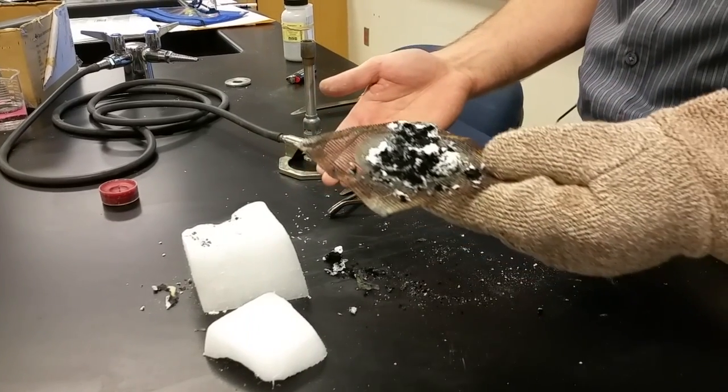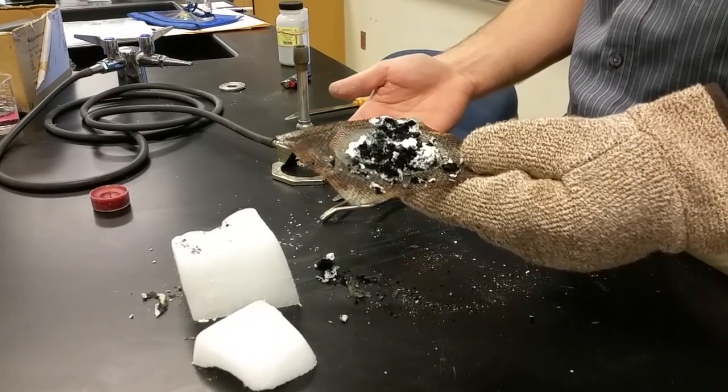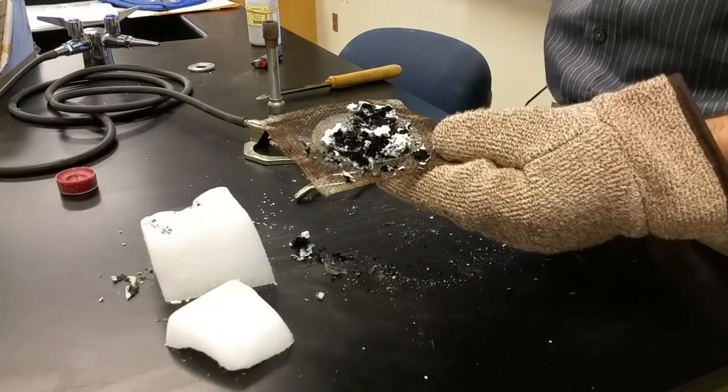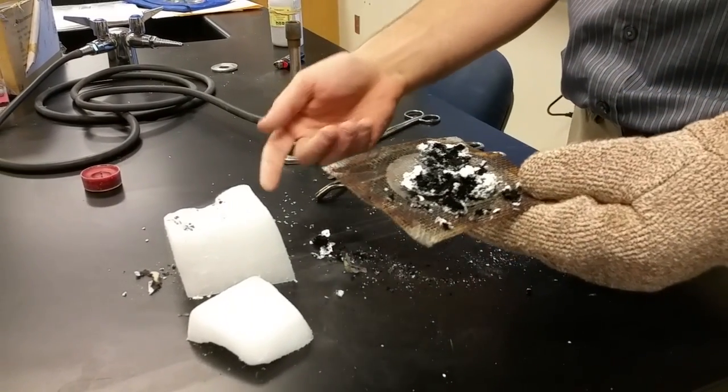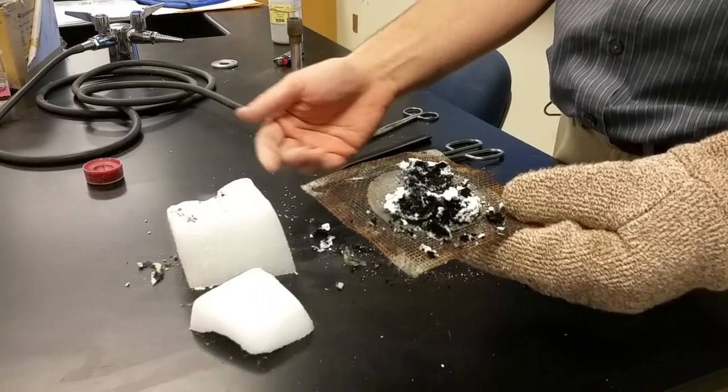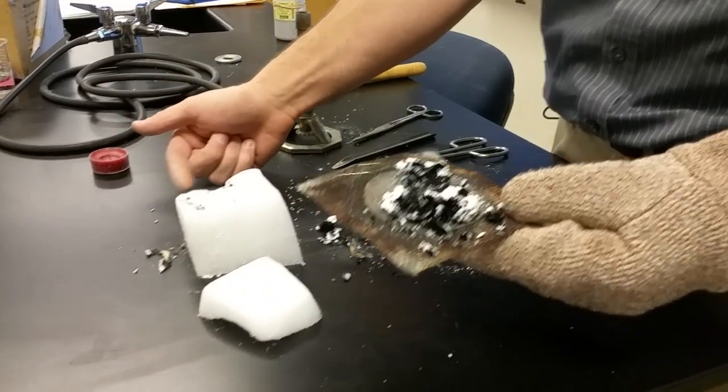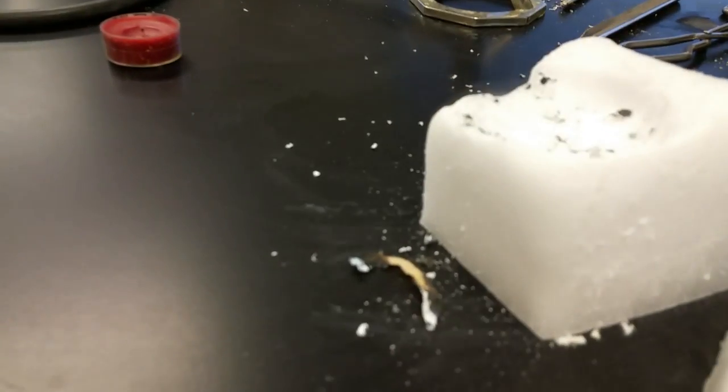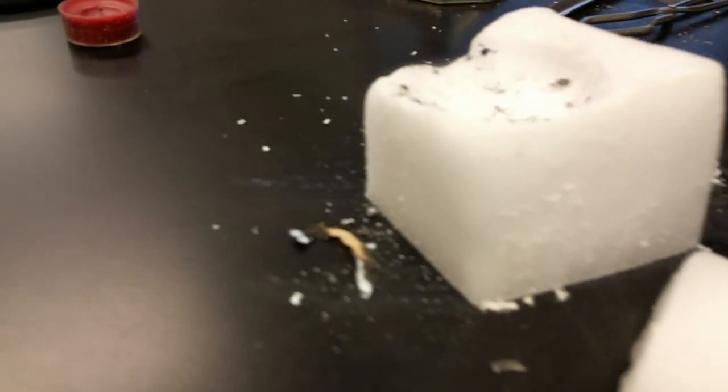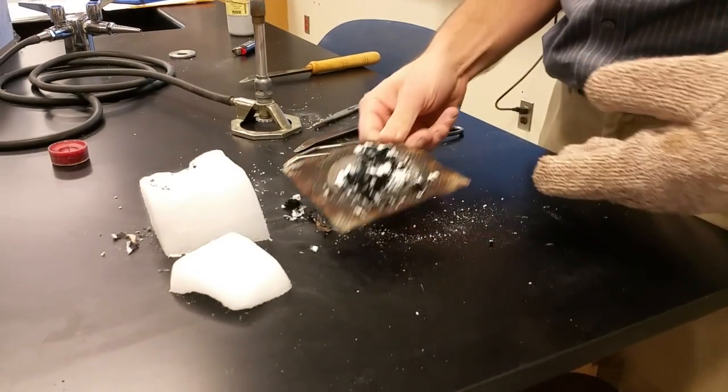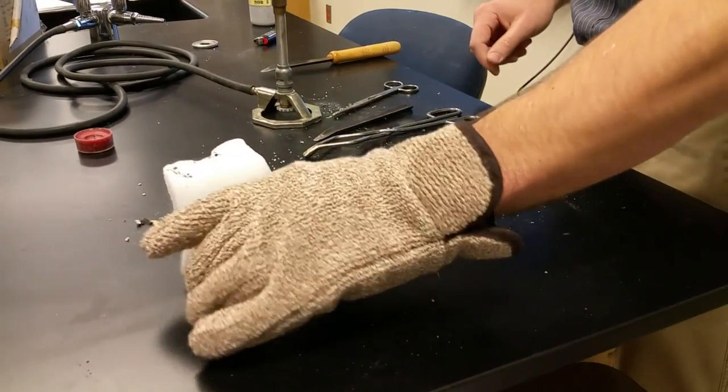Does anybody know why it's called dry ice? Because it's... You know this already. It doesn't go through all the layers. Right. There's no liquid. It's going straight from a solid to a gas, which is what you kind of see coming off on the side. There's no liquid phase in between. My favorite is when you hit it across the table. I'm kidding. Is everyone going to take our machine? Nope. Yeah.